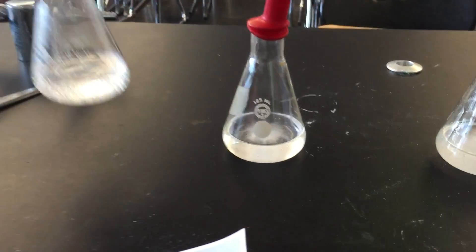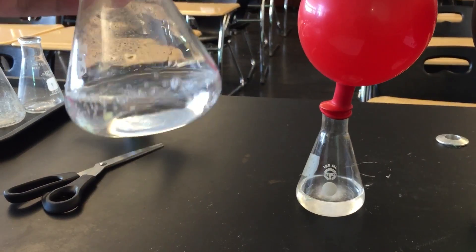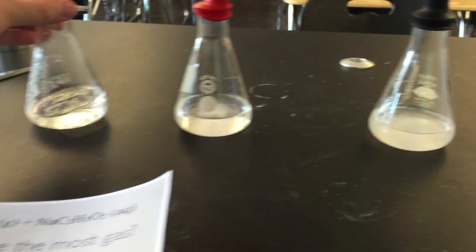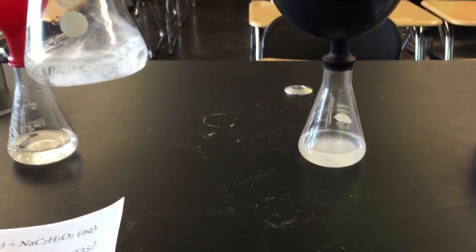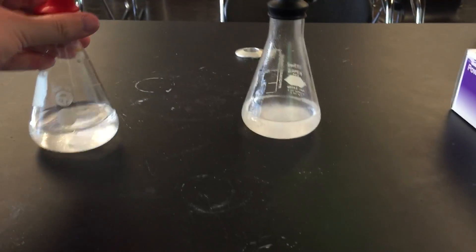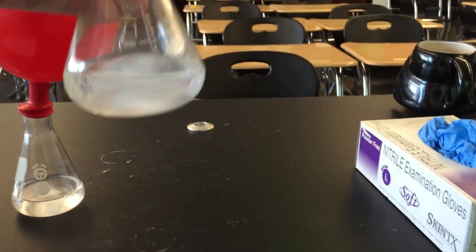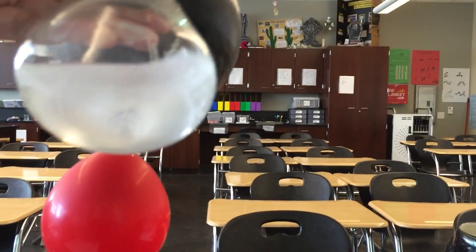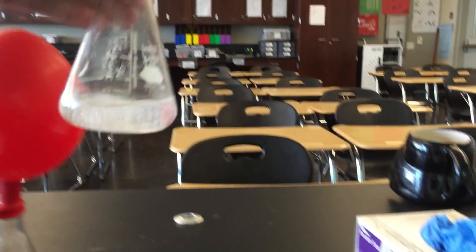Something else that you might notice is that the bottom of this container is totally clean, that it's all liquid. And then this is still reacting a little bit. But also, other than the bubbles, it's totally clean. This flask, on the other hand, which is still kind of reacting, you can actually see at the bottom here there are solid chunks of baking soda in that reaction flask.